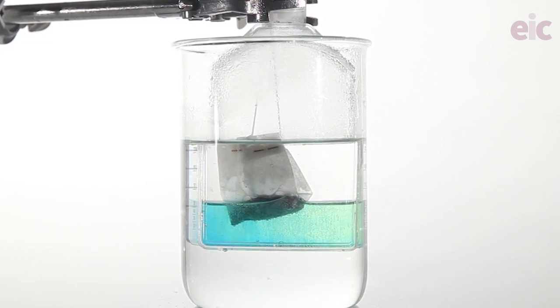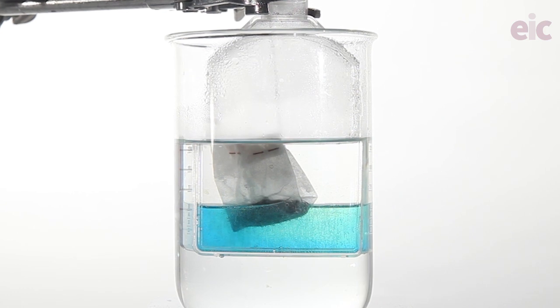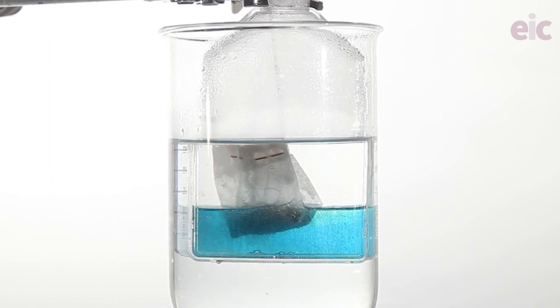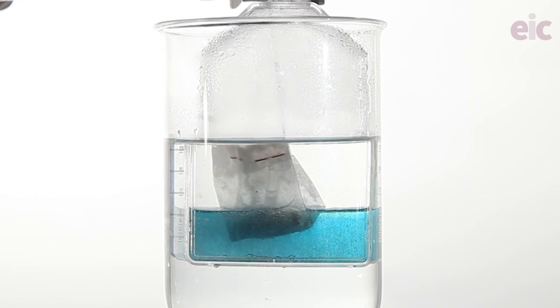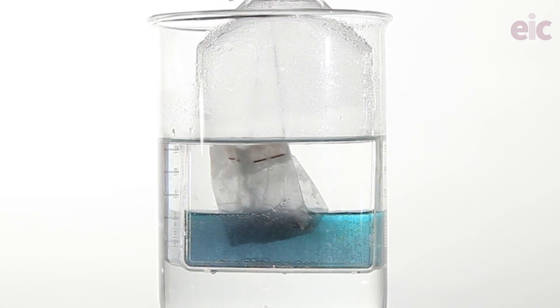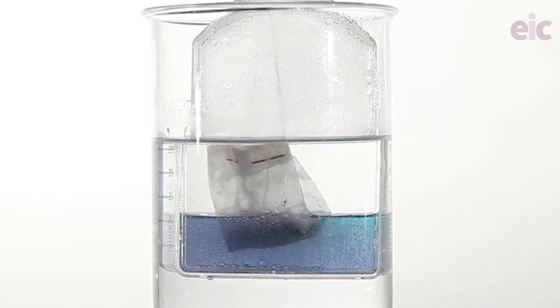Only now do I add water from a freshly boiled kettle to make a larger water bath in which the reacting solution is totally submerged. My thinking here is that the transition to vanadium 4 is actually quite quick, and if you'd preheated the solution, it probably would go a little bit too fast to see any nuance. By submerging in this way, the temperature of the solution is going to increase by the time that we get to the lower oxidation states when we need that kinetic boost the most.